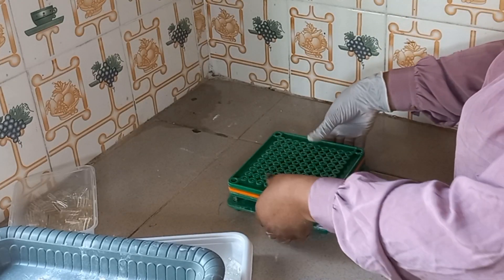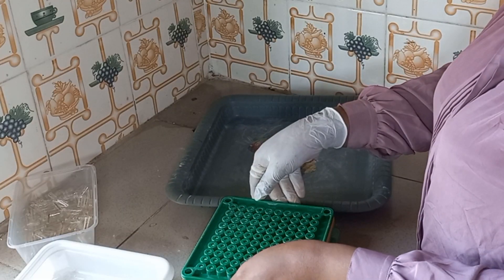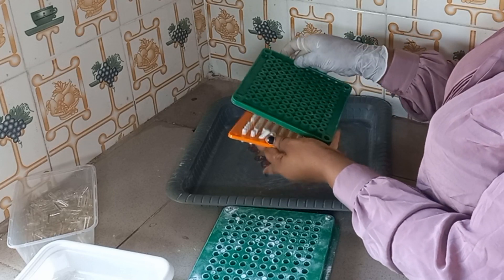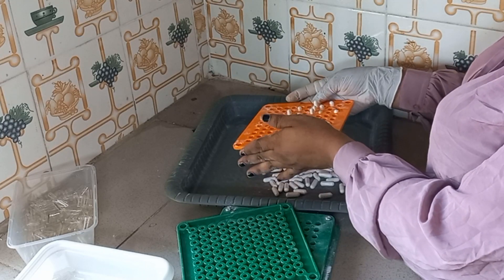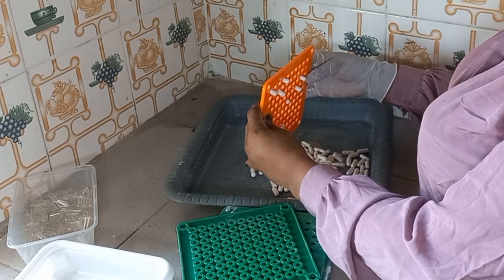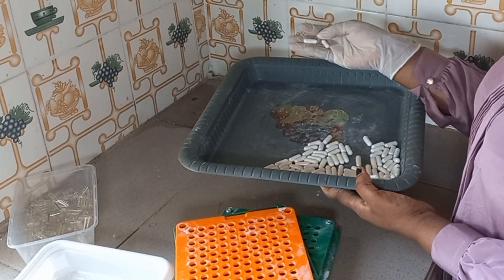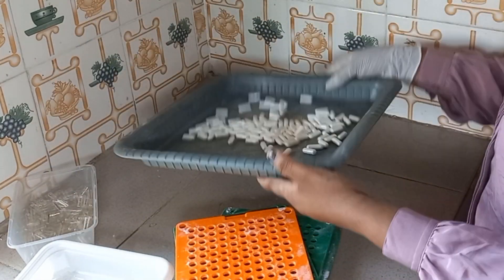Let me show you first — very well, this is what we have, just one of these. We have a moment to see what we do. Now it looks so easy.